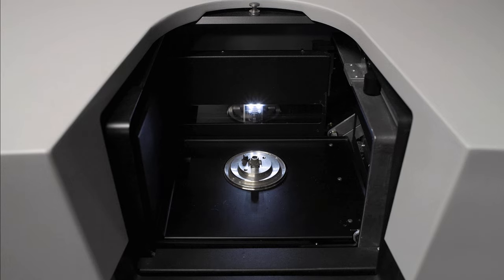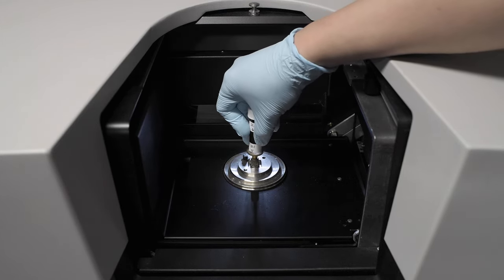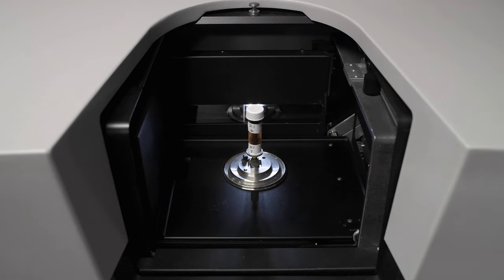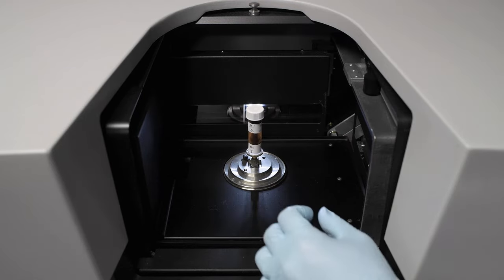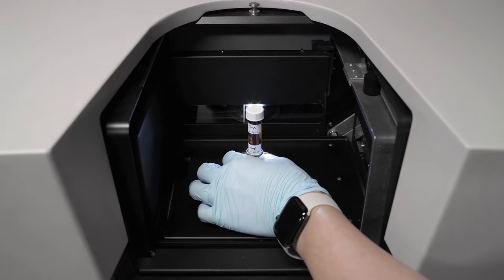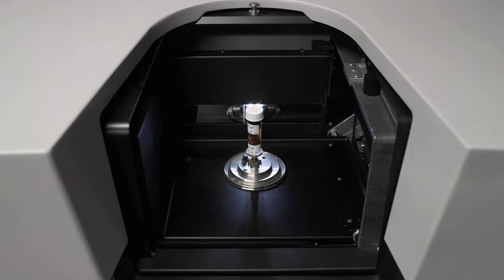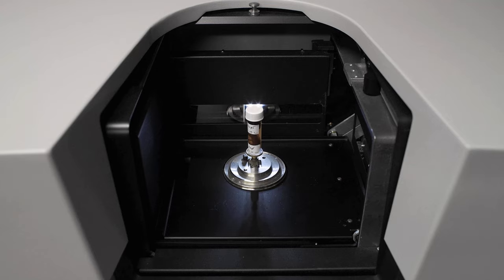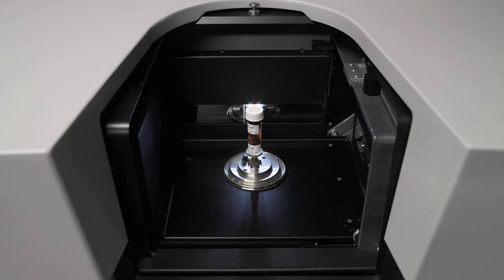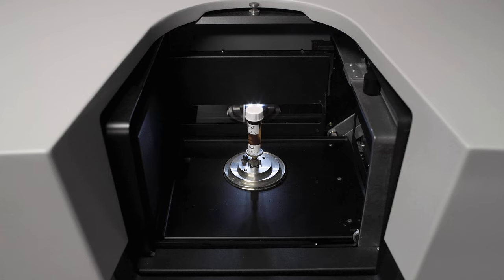Before placing your sample onto the brass holder, you can apply a small amount of wax on the surface of the brass mount to help secure your object. The wax can also be located in the toolbox next to the scanner. Once the sample is securely placed on the brass holder, insert the base of the holder into the central hole of the collet on the object manipulator. Secure the holder by turning the brass ring in a clockwise direction. Do not apply significant torsion or over-tighten the brass ring.